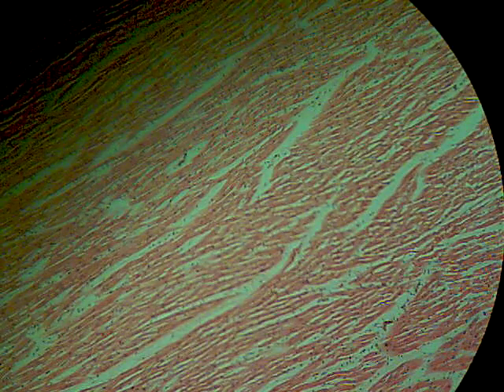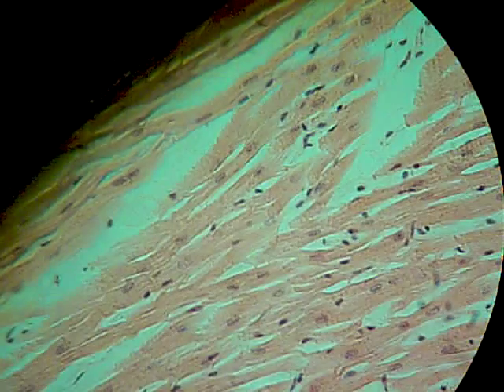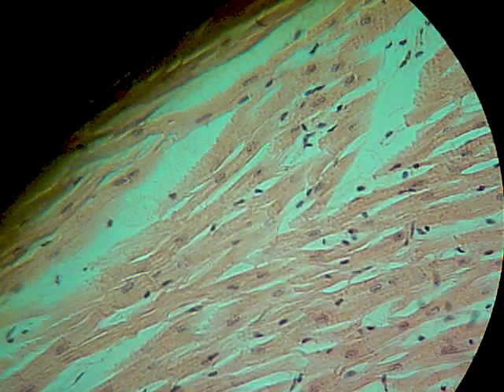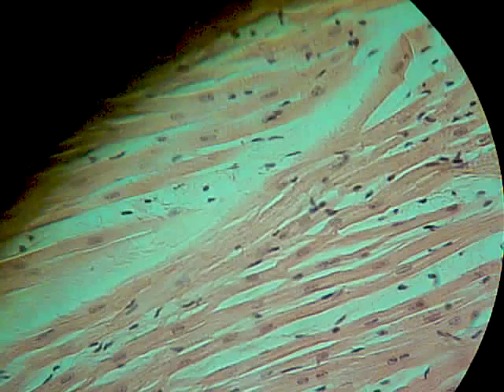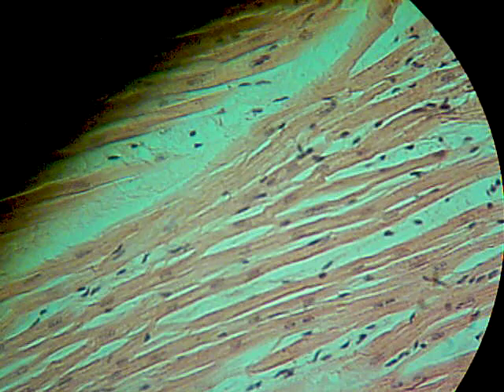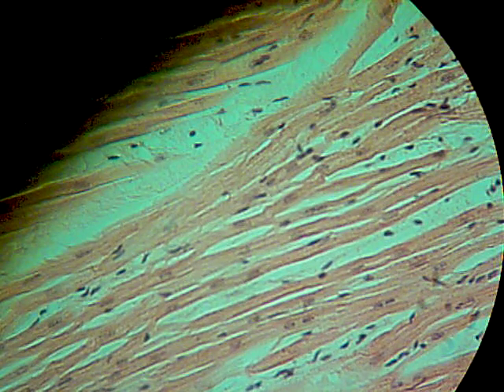The thing that you'll note if you go to a higher power with this one is that these cells are branching. There are individual nuclei you can see, but it has a branching pattern. That's cardiac muscle.